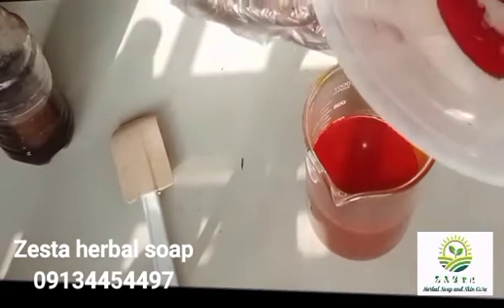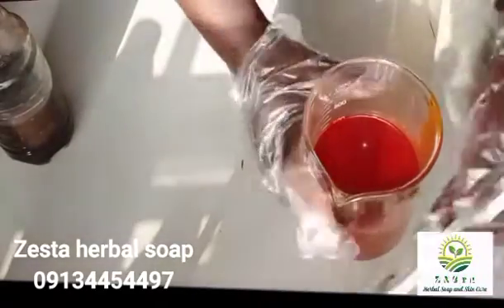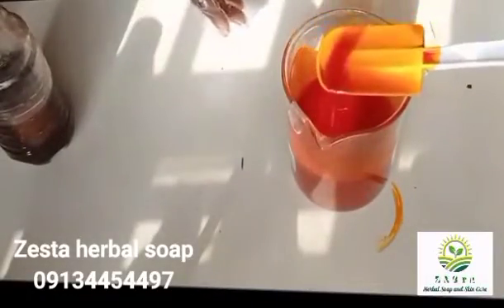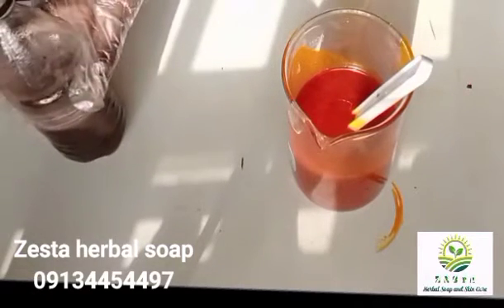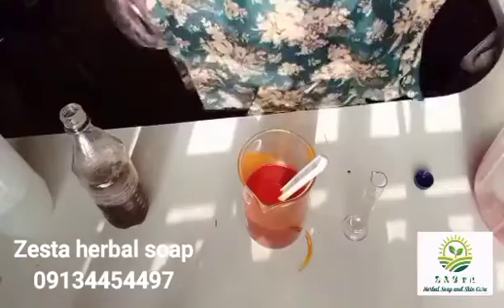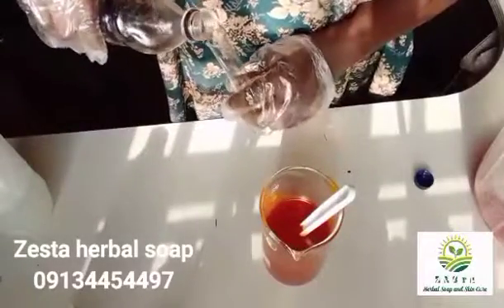This is the first one — it's still looking pink and it's developing some kind of foam on top. The container is warm. I'm repeating again with a clean glass beaker. This is my raw palm oil. I'll be adding my sulfonic at 6 mls. This is my clean tube — I'll get my 6 mls of sulfonic because I'm using 600 mls this time, not 500.